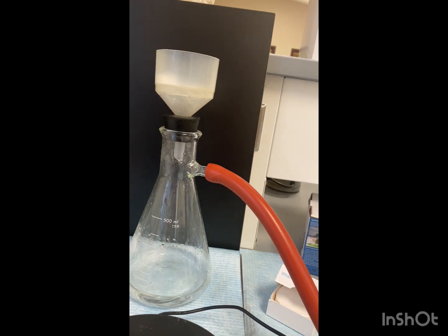Alright, we're just going to let that dry. Once it is dried, we're going to record the mass. And then after that, you'll take the specific rotation using the polarimeter.